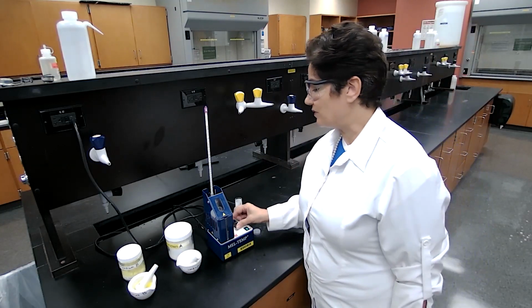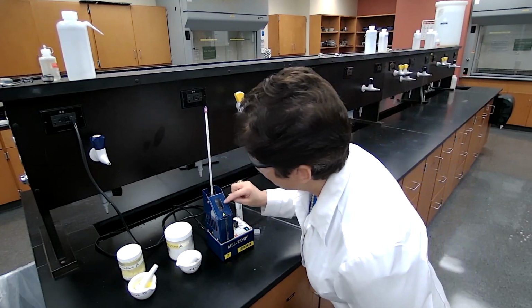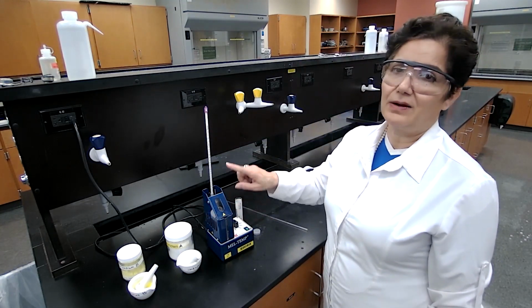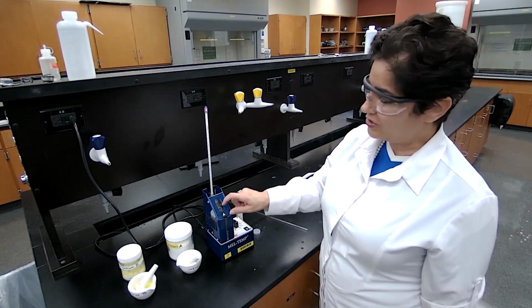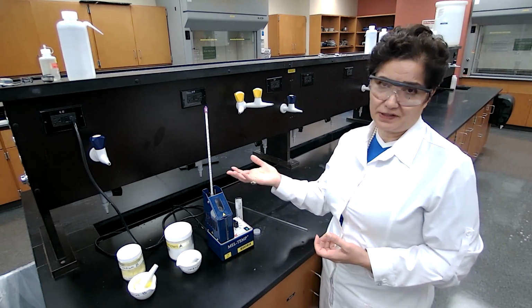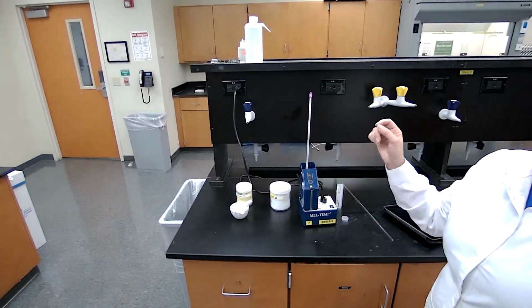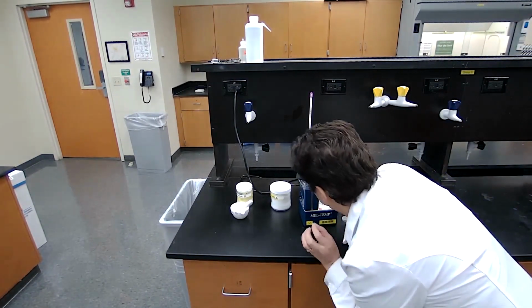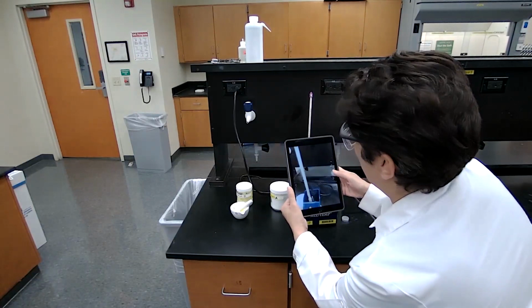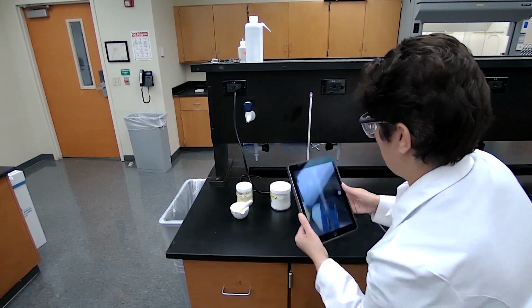So I'm going to set it between 4 and 5 and monitor the temperature and the capillary tube through this eyepiece. As soon as I see it's melting, I will take a picture of the temperature with the initial melting and the final melting for you. So I can pause the video at this point until it starts melting. It's about to melt, and it's actually melting very nicely. It's shrinking. Now, I'll post it for you. Okay.